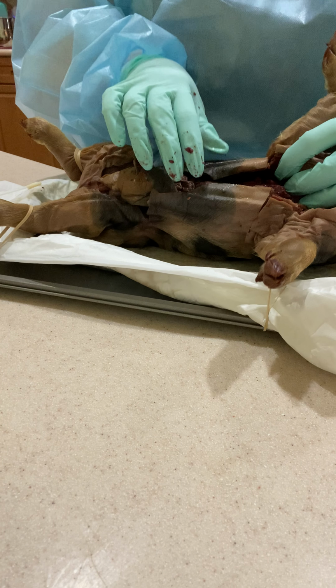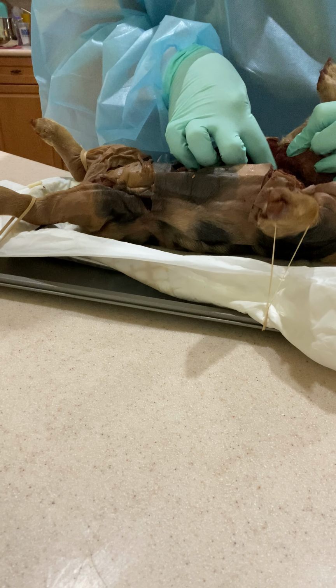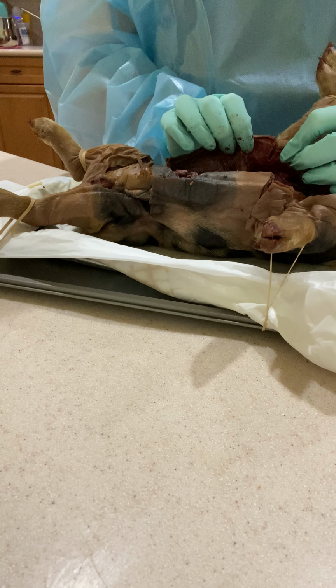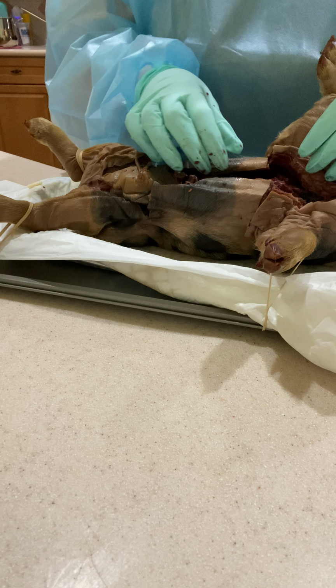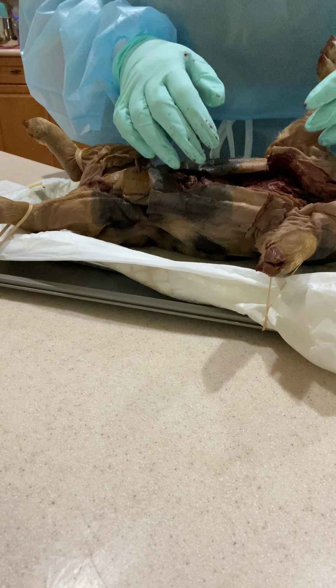Your visceral pleura, I don't know if you can see that either, but it's along here. It's a serous membrane, a fluid that covers the lungs to protect them from friction, so that friction doesn't damage them, or even hard impacts. It helps protect your lungs.